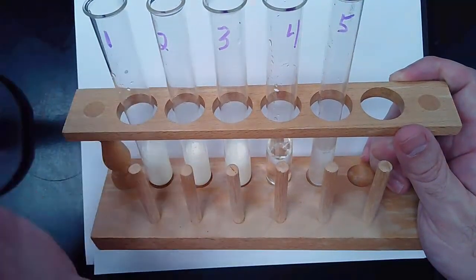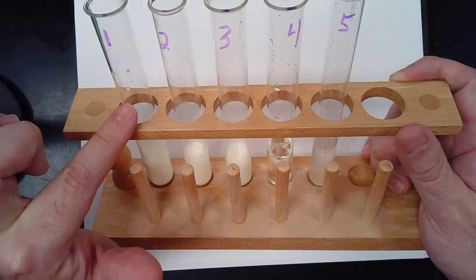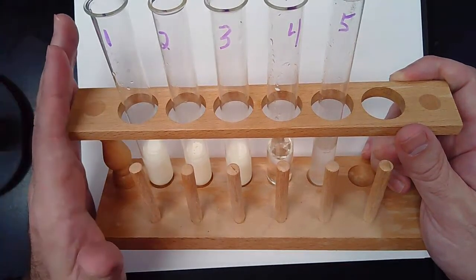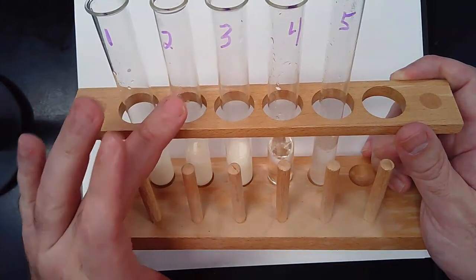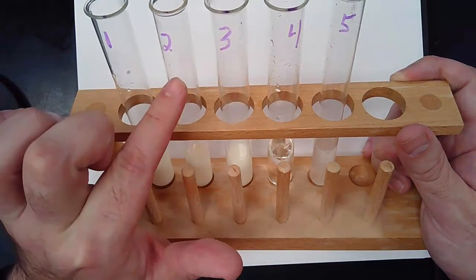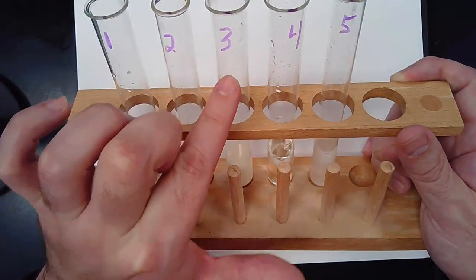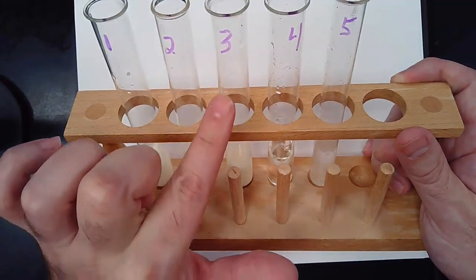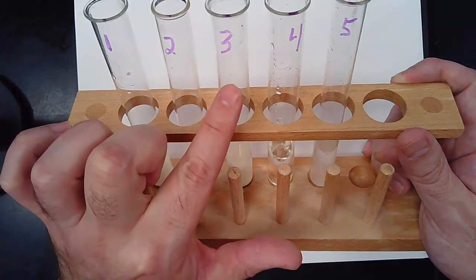So anyhow, here's test tube 1. Test tube 1, remember, has milk in it. So this has lactose sugar. And we added some water, just as our test. Here's test tube 2. Test tube 2 also has lactose, and it now has the lactase enzyme. Test tube 3 has milk in it, so it has lactose, and we added the denatured, the shape-changed enzyme.